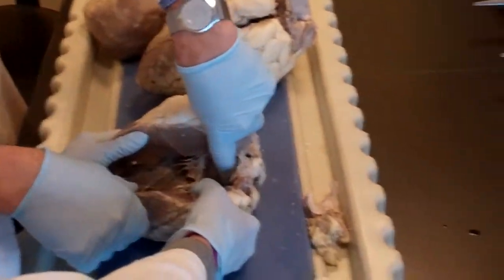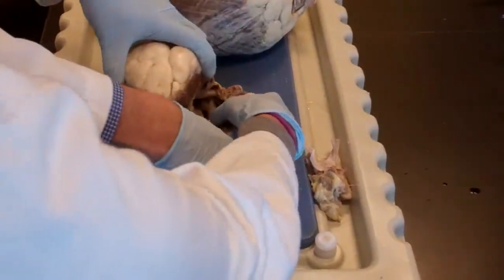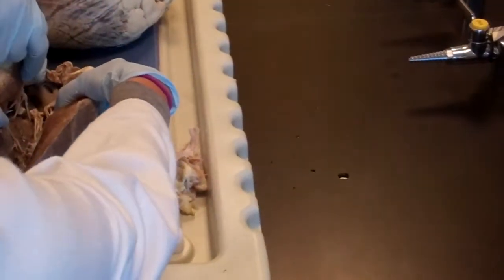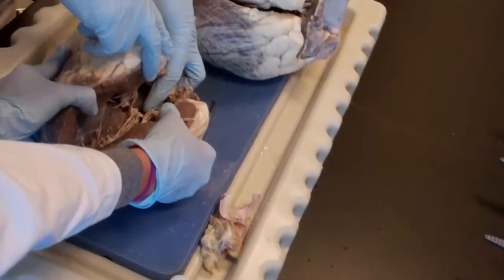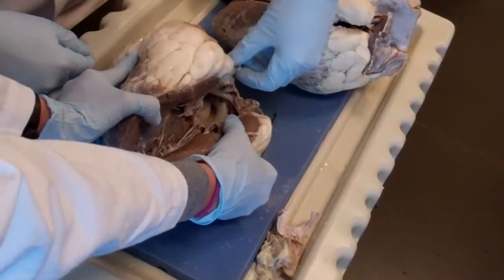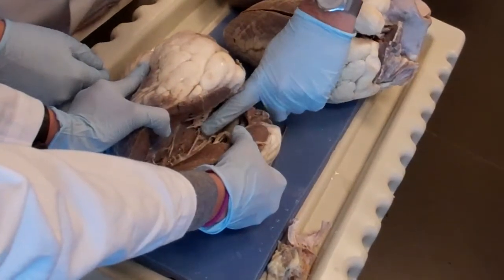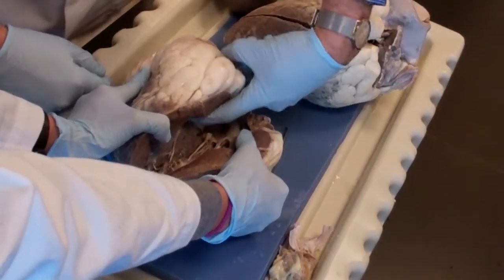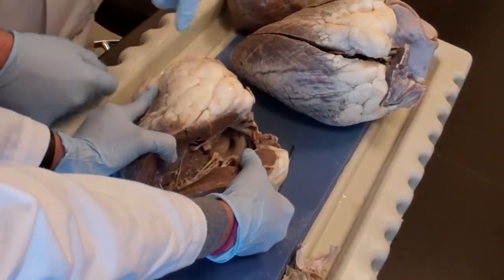This is the huge opening of the left atrium. Bring it here, please. See here. This is how I got in. I just tore this. So this was the auricle. It was like this, and I made an opening and I went through. Okay? So this is the atrium. This is the auricle, the ear. And this is the atrium, and this is the mitral valve right there. And I am between the 2 flaps of that valve, chordae tendineae, same situation.